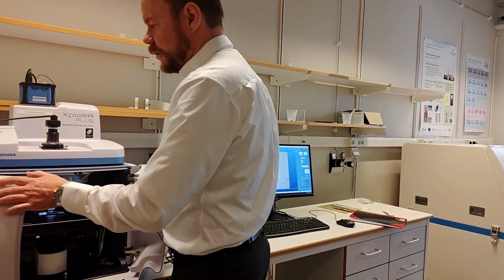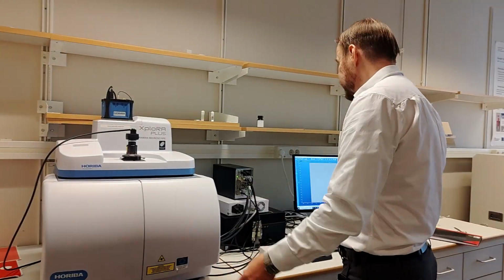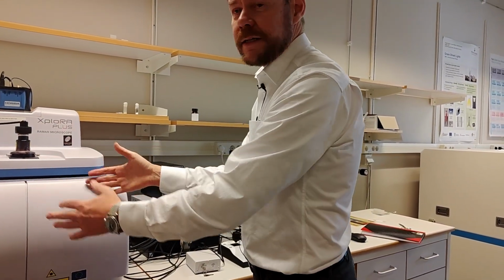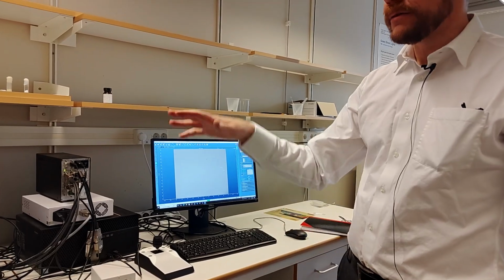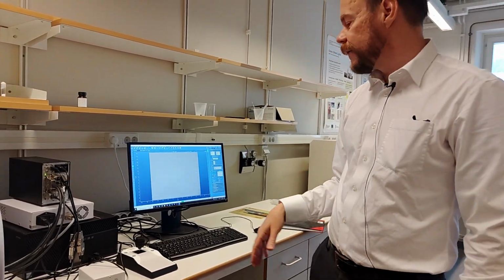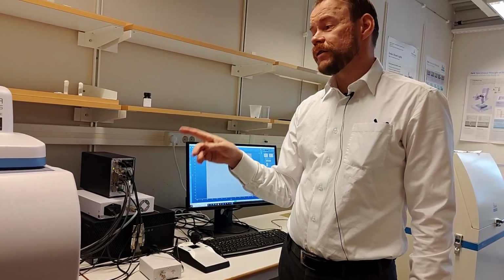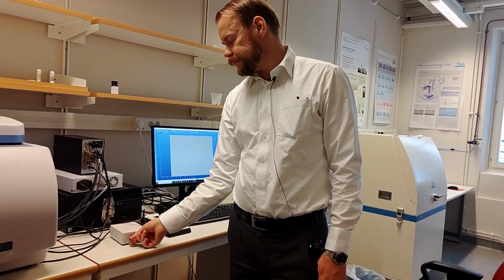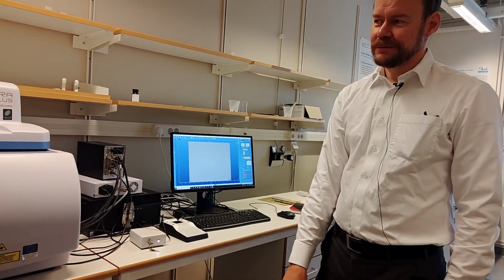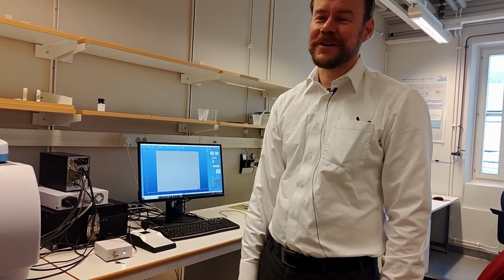To get the laser going, we need to close the box. Make sure it is completely closed. Since this box slams a little bit, it's good to check that it's still in focus, so the stage hasn't changed by the vibrations. But to do the calibration, we need to first turn on the laser also. There's a key here. You need to turn it on. So many people forget that, and then they sit here for 1 hour wondering why nothing works.